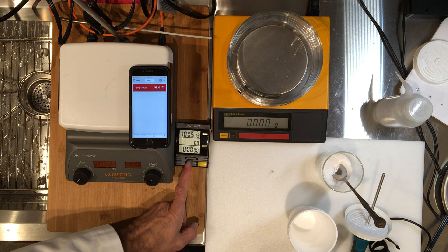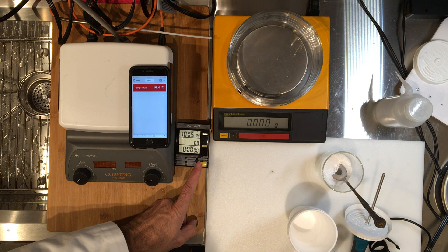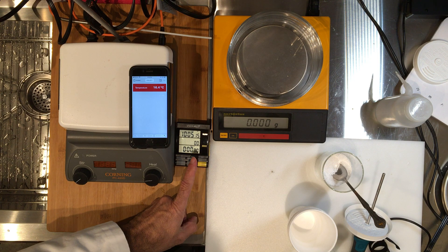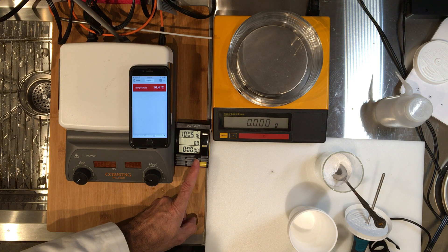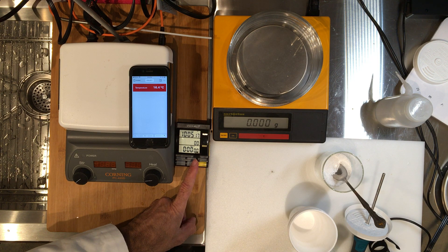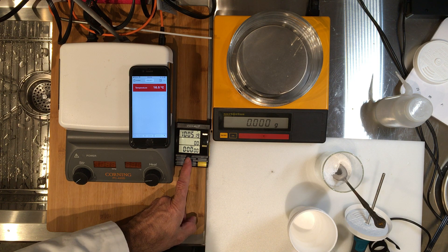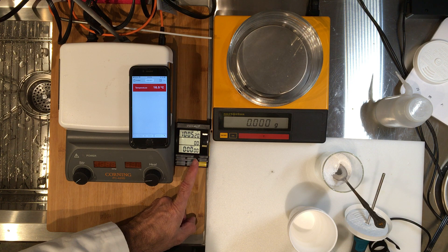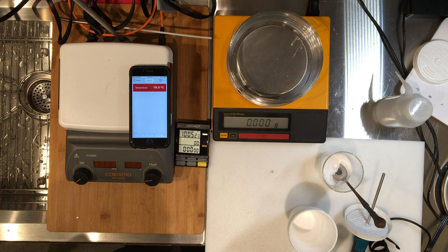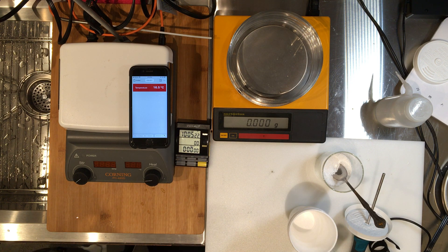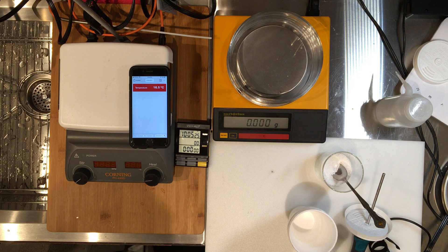I have a timer here. You can record it in seconds, and then once it goes over a minute it will show you minutes and seconds. The idea is to record the temperature every 15 seconds.